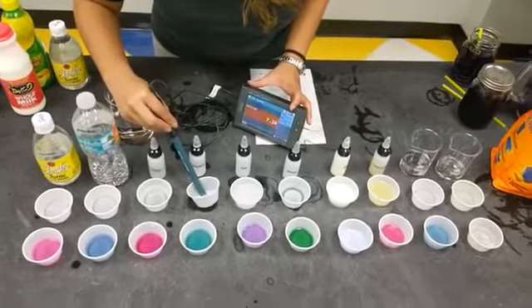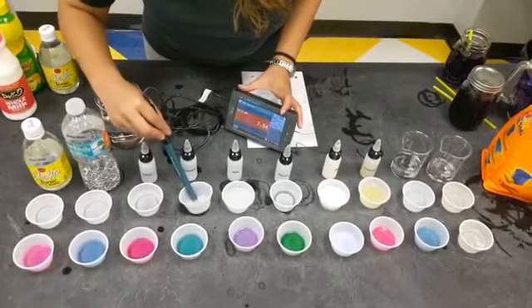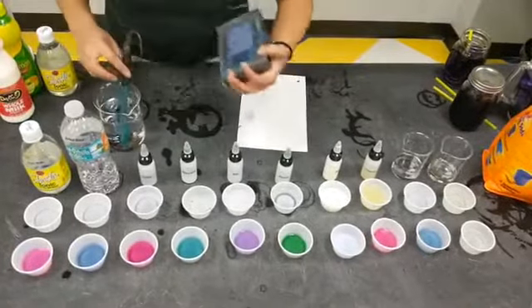All right, so it is definitely above a 7. All right, and let's move on to our soap. Oops.